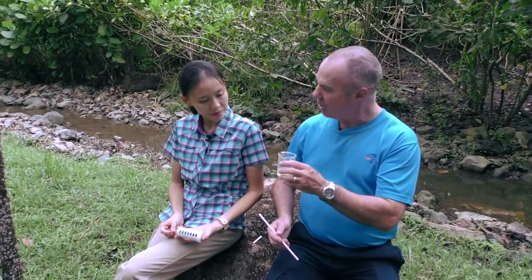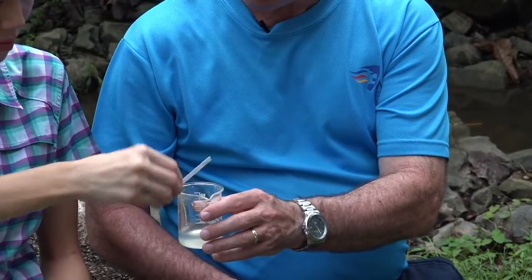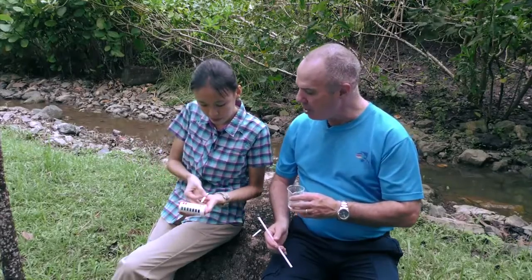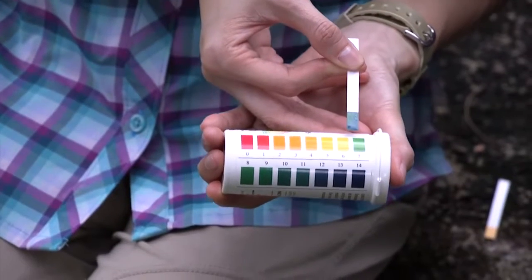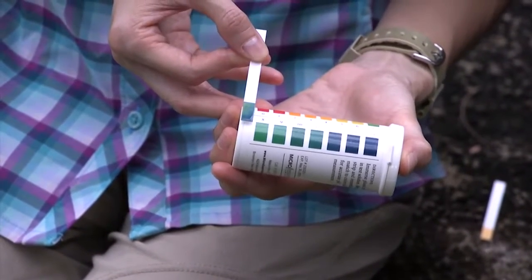So Grace, let's demonstrate how gases dissolving in water can affect the pH. What we're going to use is lime water here, and we're going to start by measuring the pH. And the pH of the lime water is somewhere around 7, possibly a little bit more, maybe about 8. Now what I'm going to do is introduce carbon dioxide into the water by respiring. And this basically is what aquatic organisms do also in water bodies.